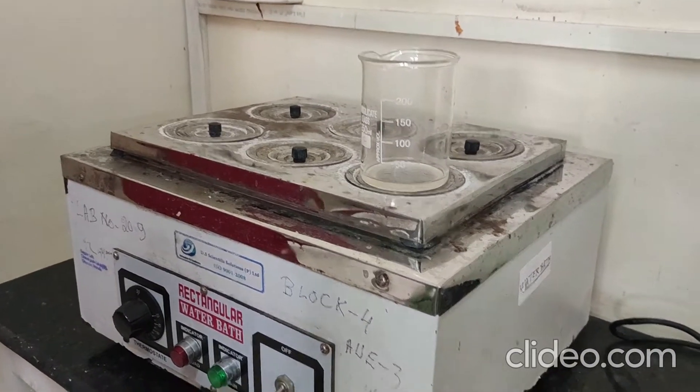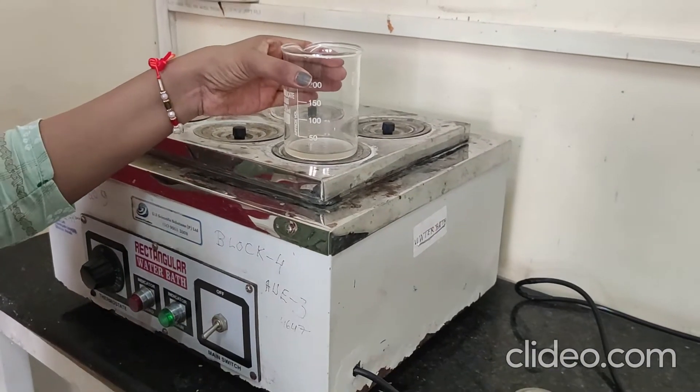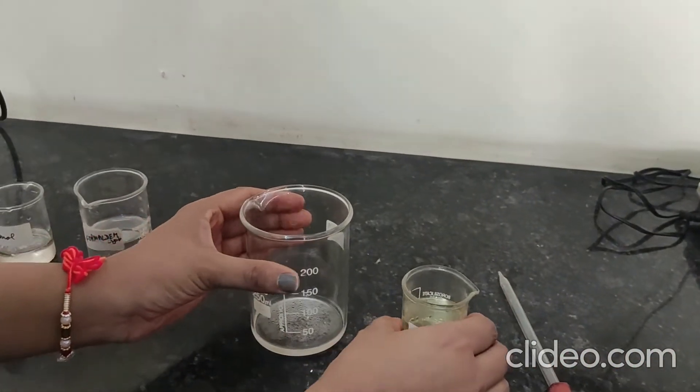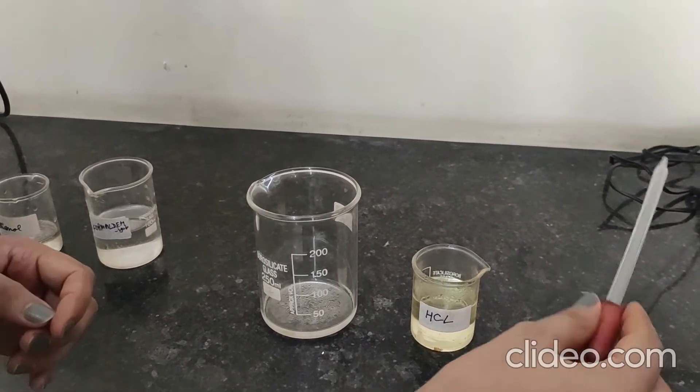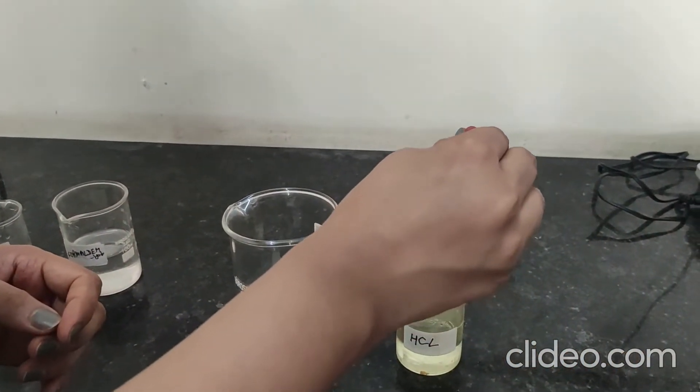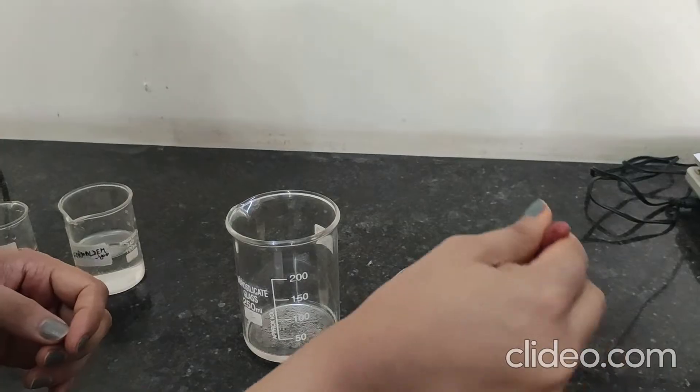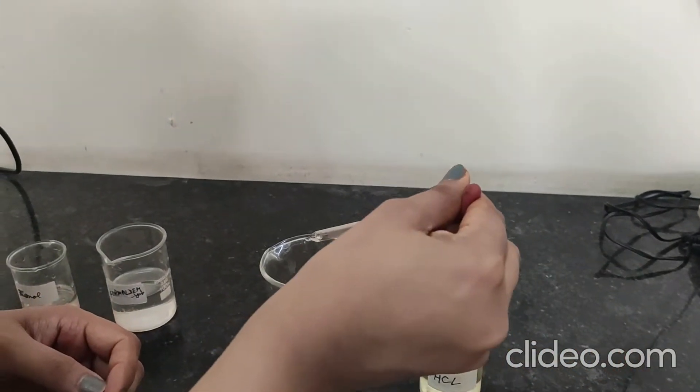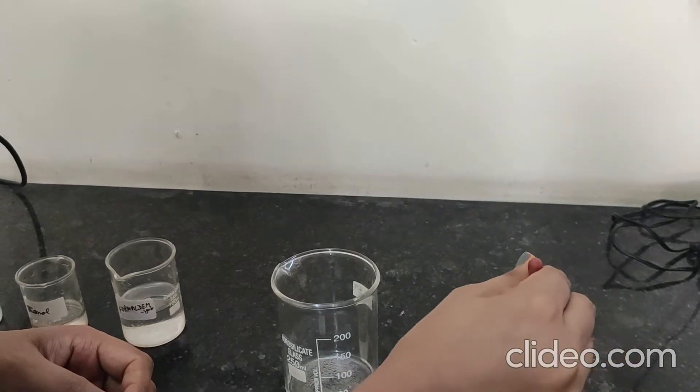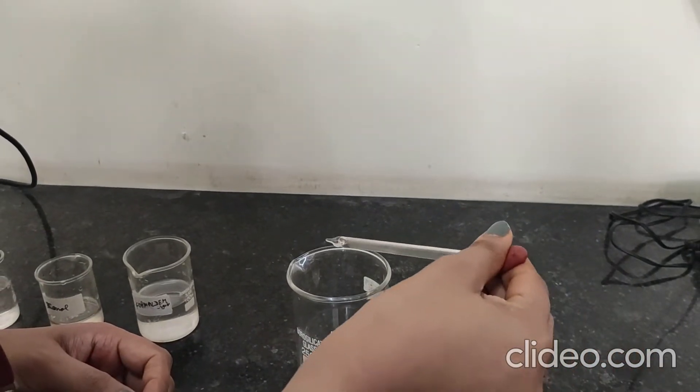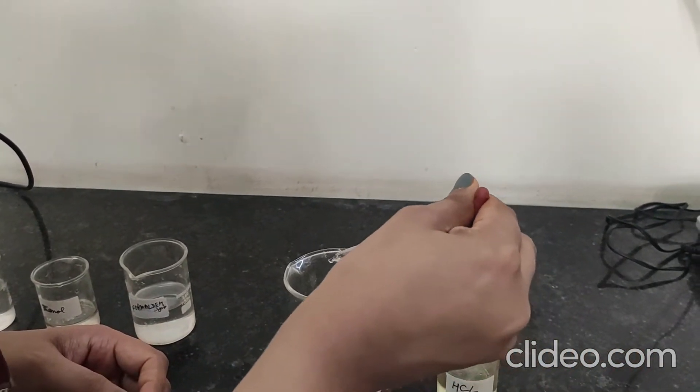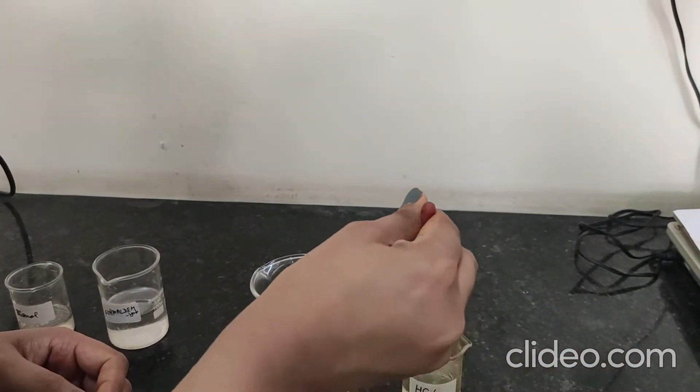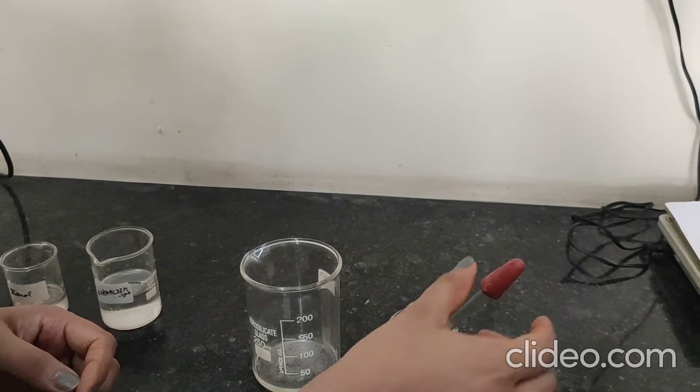Now remove it from water bath and add 5 to 6 drops concentrated HCl solution. Stir it.